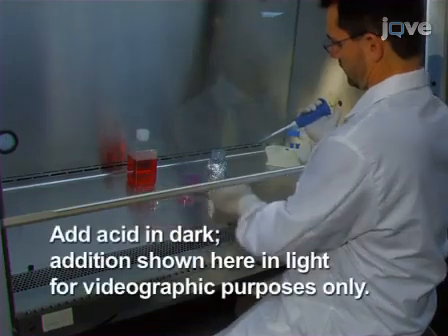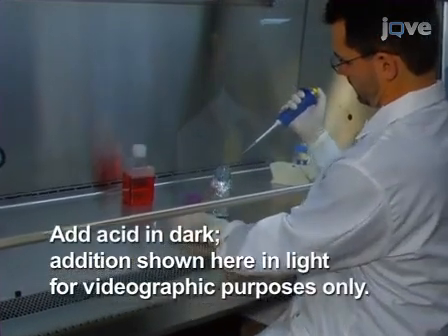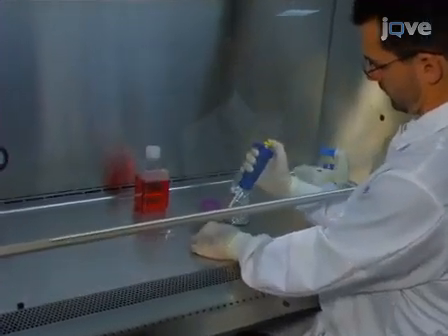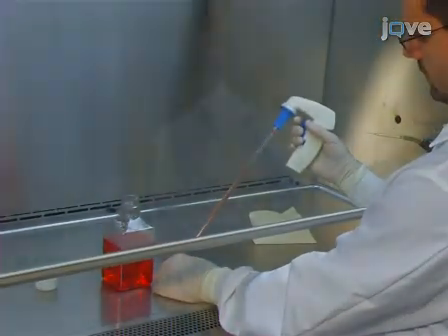When culturing neuroblastoma cells, add 10 micromolar of retinoic acid daily until cell differentiation into a neuron-like state is observed. Replace the standard cell culture media every 3 to 4 days.